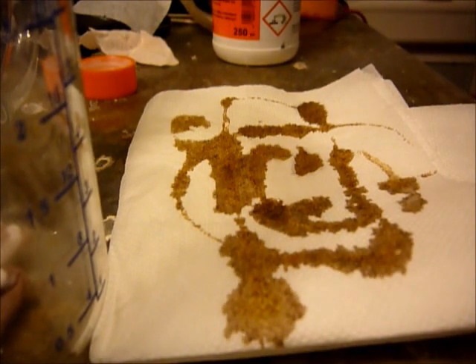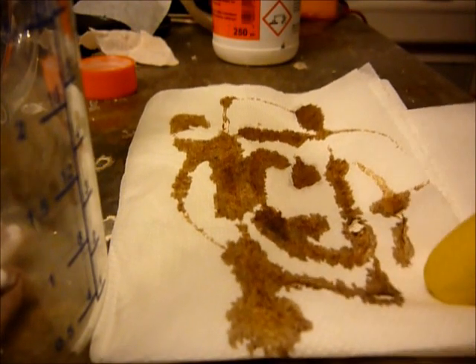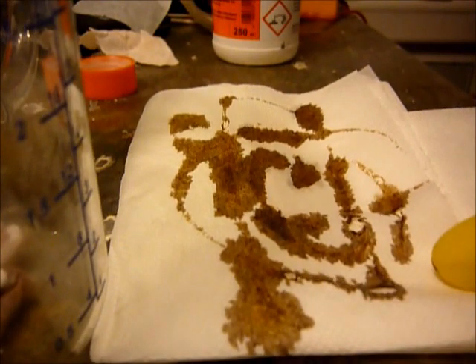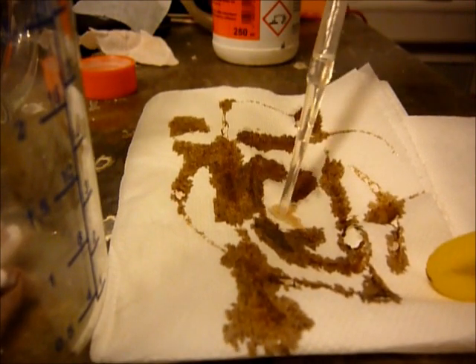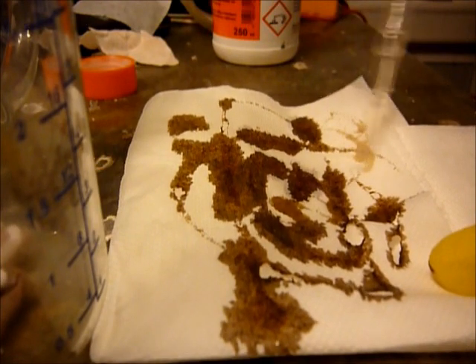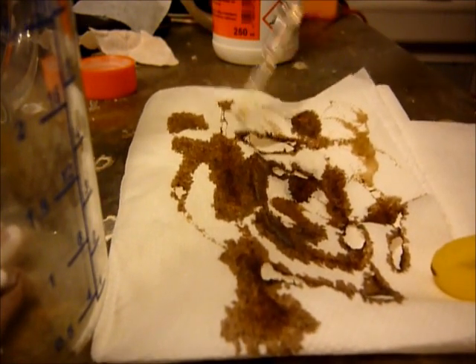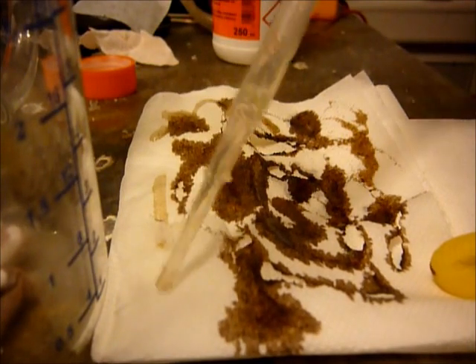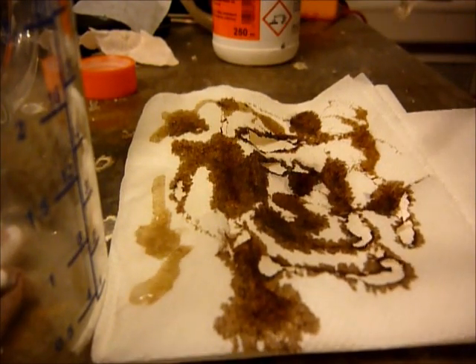And in a few seconds holes will burn through the paper. So also your body is made from carbohydrates, and these carbohydrates will be dehydrated by the sulfuric acid too.